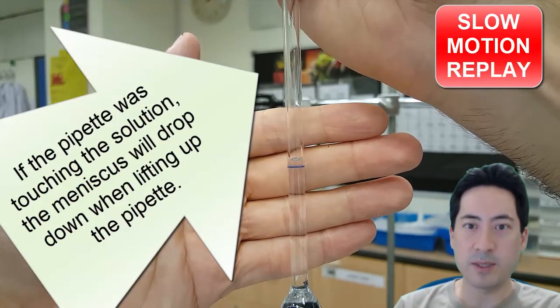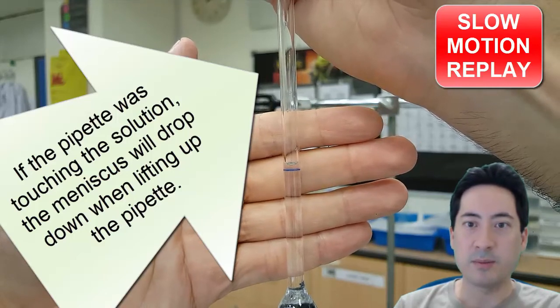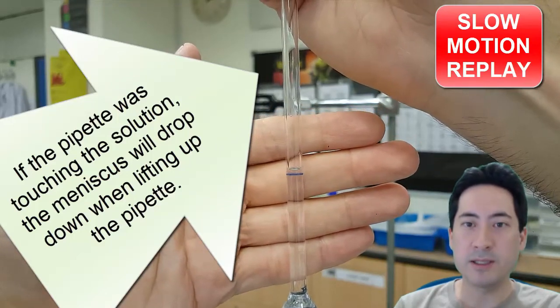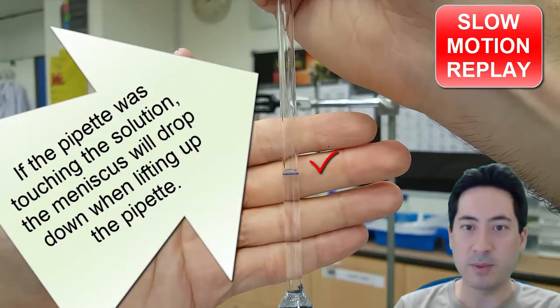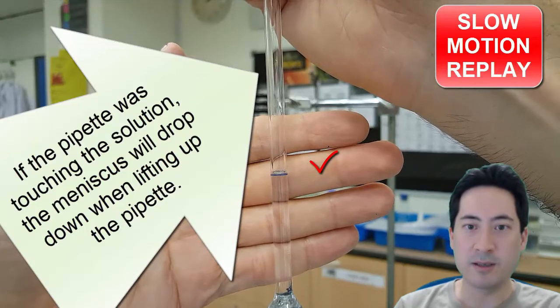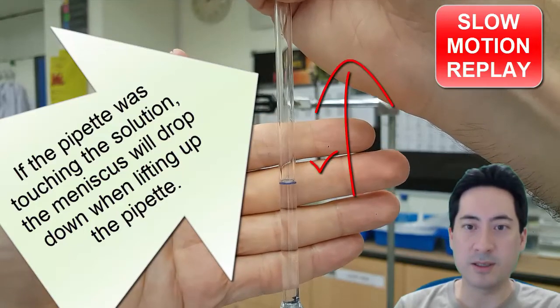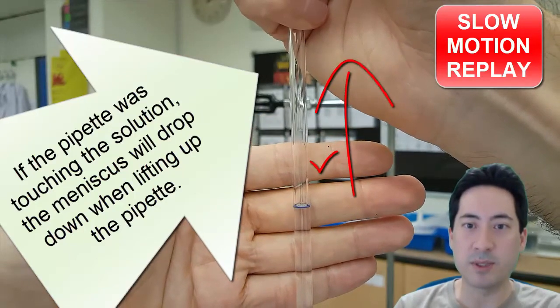So the amount, to make sure it's above, the pipette is above the liquid as you're releasing out the solution to get the meniscus on. Because if the meniscus is, if the pipette is inside the liquid, it's going to affect the meniscus. The meniscus isn't going to sit on it. It's going to get pushed up by the liquid.